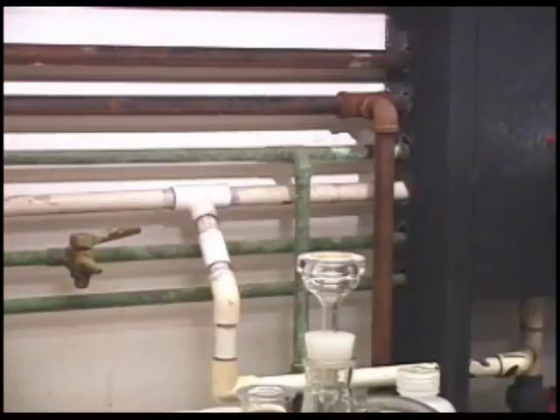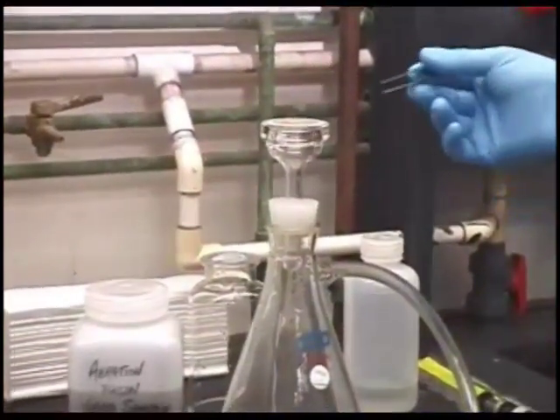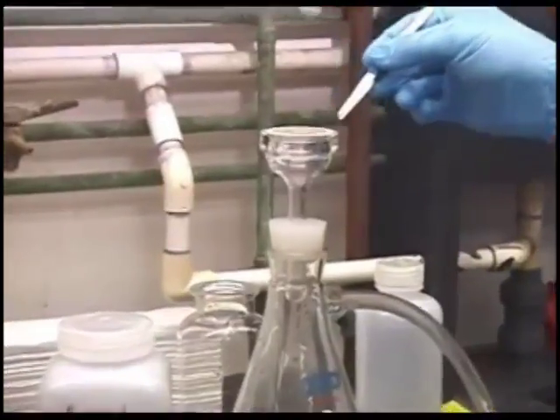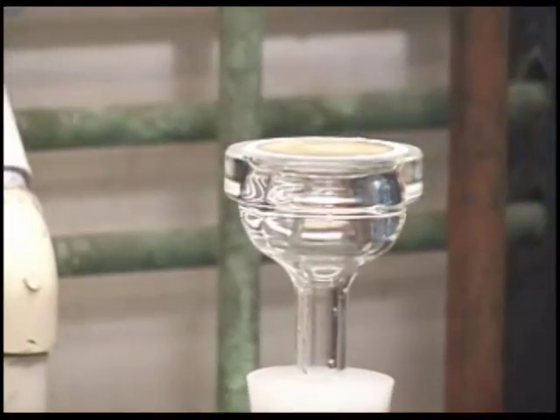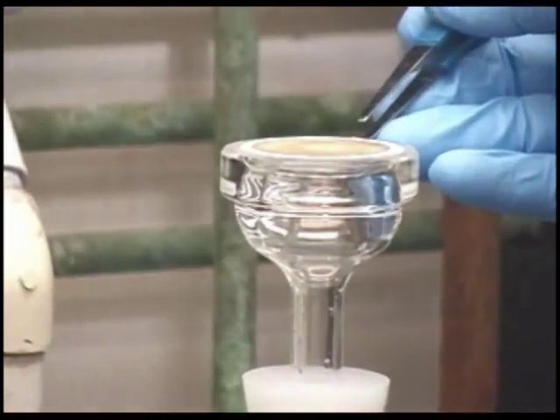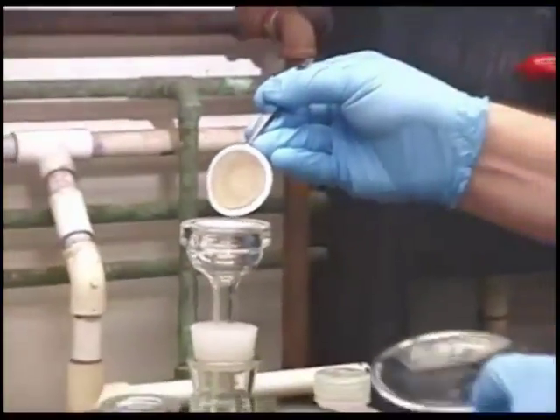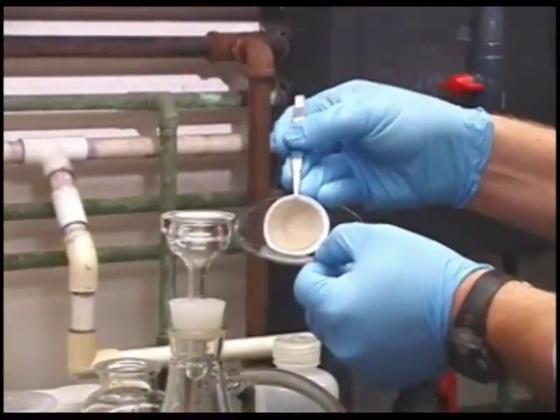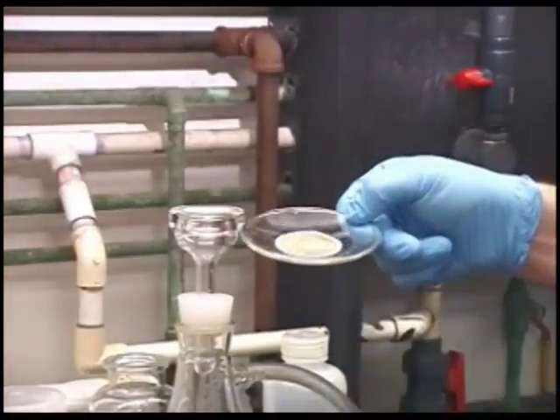In this case, we used a 3 milliliter volume of the aeration sample. Any larger volume would clog the filter prematurely. It's also a good idea to make sure that the liquid that has passed through the filter is clear, in this case, to ensure that all solids have been trapped on the filter itself. The filter containing the residue is then transferred to a watch glass and will be dried in an oven for 1 hour.